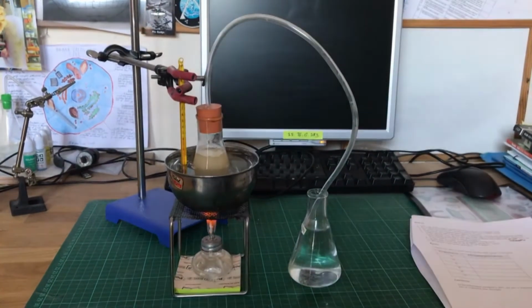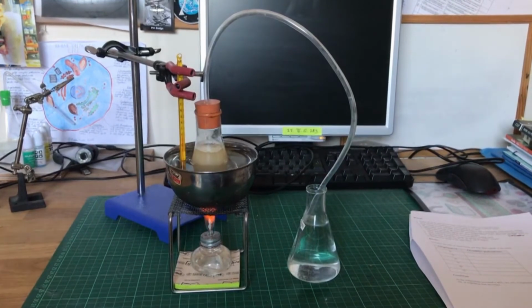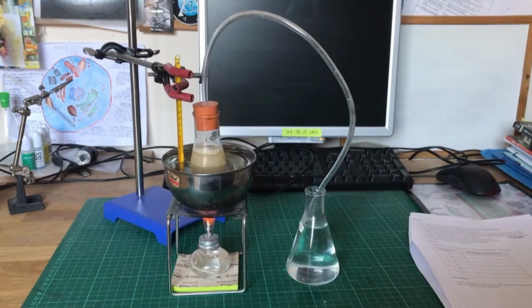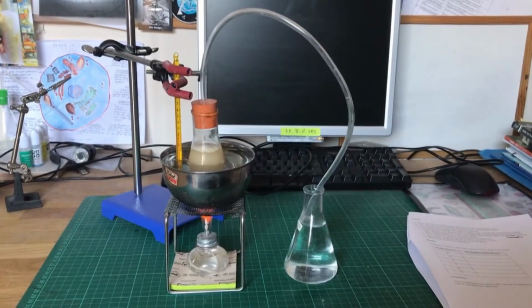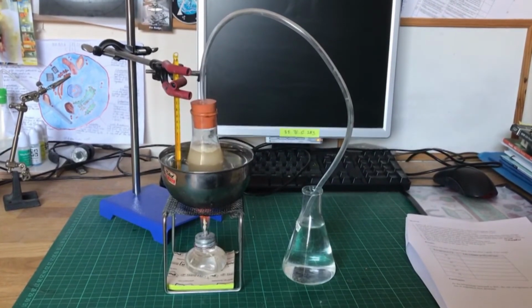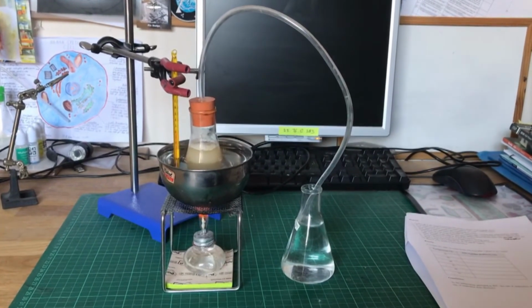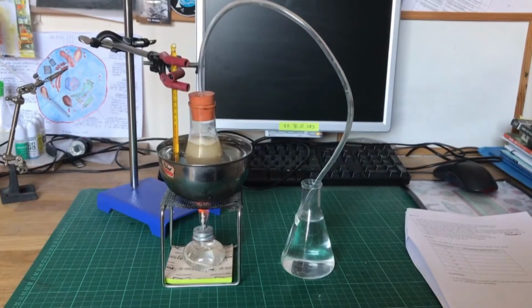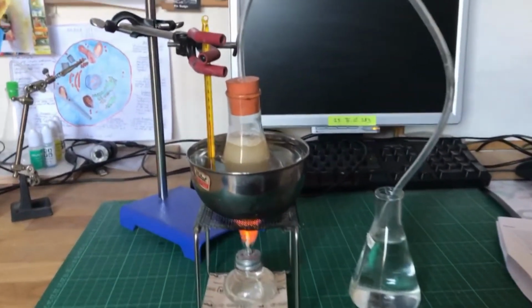Firstly, we want to place the yeast solution in the water bath. We then close the flask with a stopper, which has a tube running into a separate flask of water. We then light the spirit burner and observe the temperature at 10-degree intervals. Carbon dioxide released by the anaerobic respiration in the yeast goes from the flask through the tube and produces bubbles in the second flask of water.